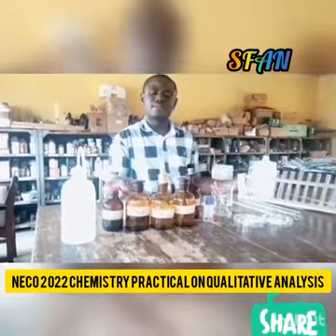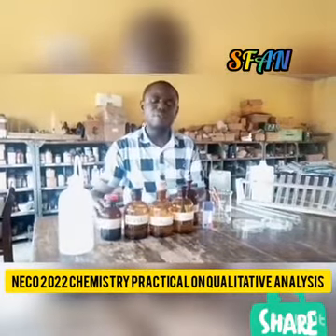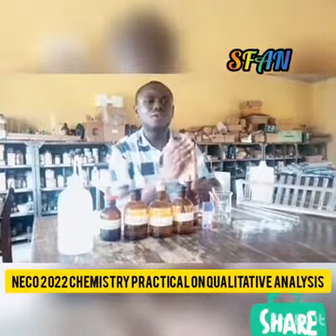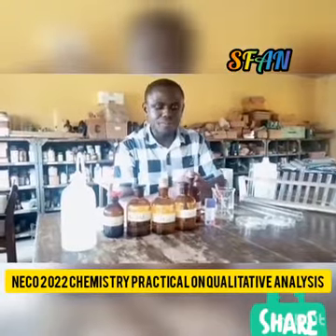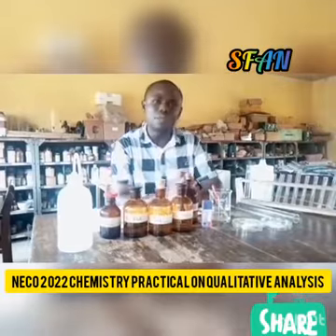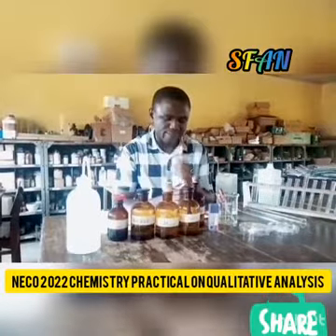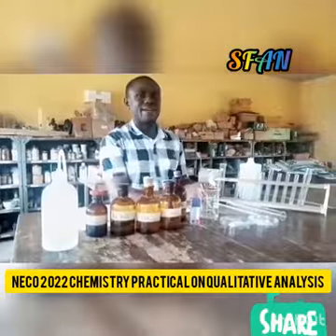Now, in this analysis, there are a few things that you should know. You should know that aluminum chloride is also referred to as a Lewis acid, and zinc carbonate is insoluble in water, while the Lewis acid, aluminum chloride, is soluble in water. Let us begin our analysis.